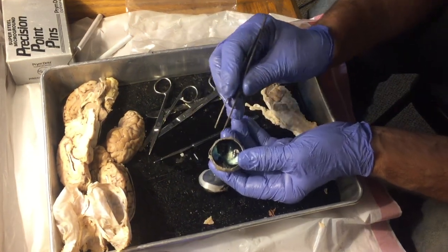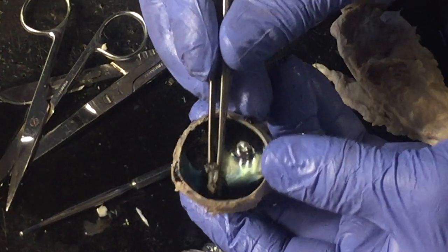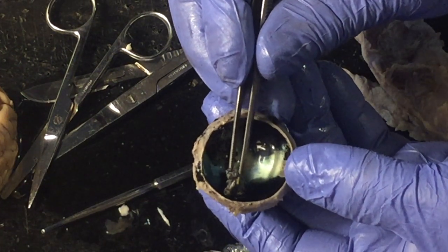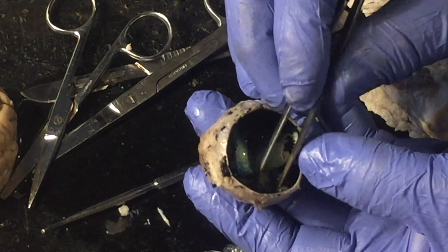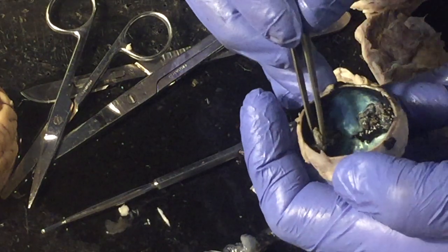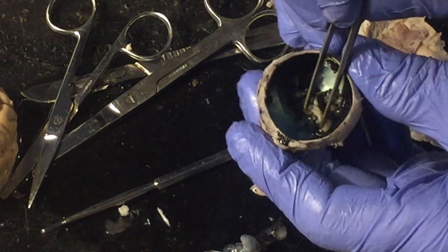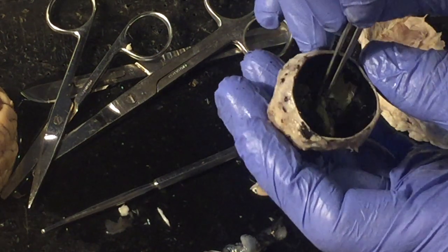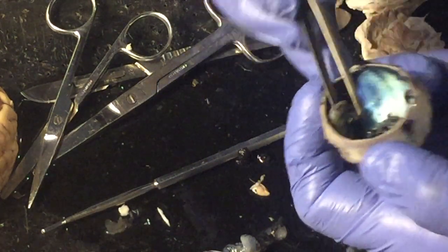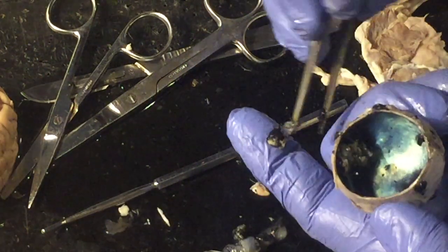When you think of the eye, think of three layers. This back layer right here, that's all folded together now, this is called, what's the inside layer? This is where the rods and cones are, connected to the optic nerve. Let's see if I can show you where it's connected here. I think it tore away a bit here. Okay, right there. I'm going to get this piece that's torn away out of there. So this is some retina that I'm taking out of there. This would have rods and cones in it.